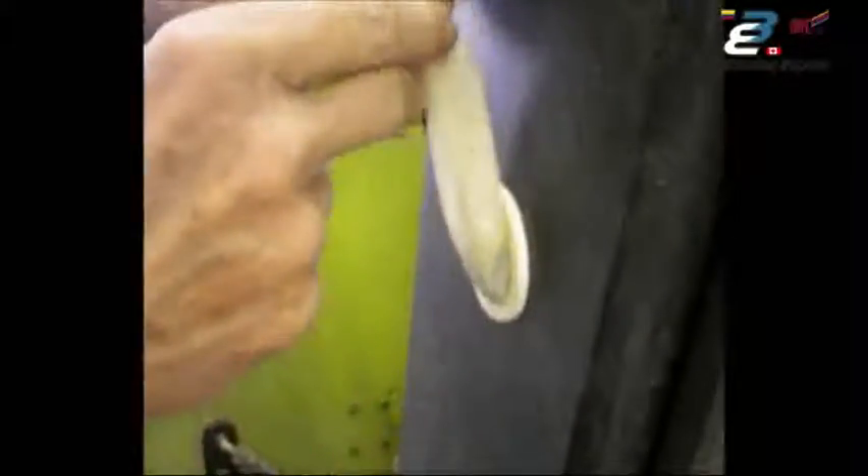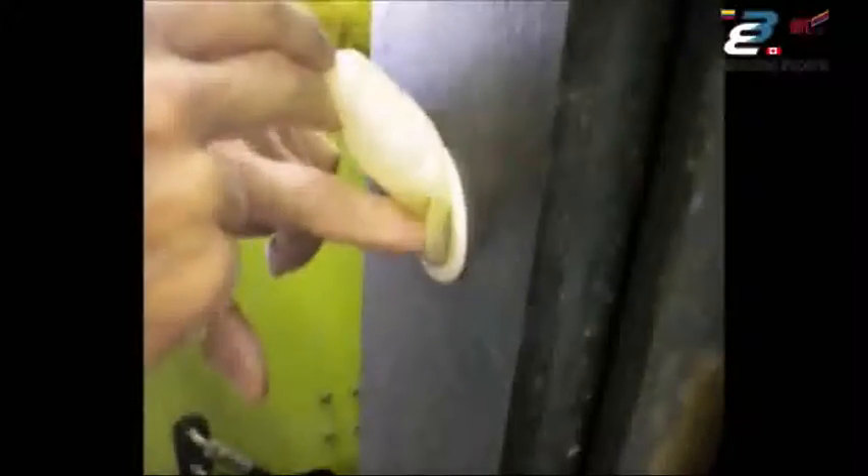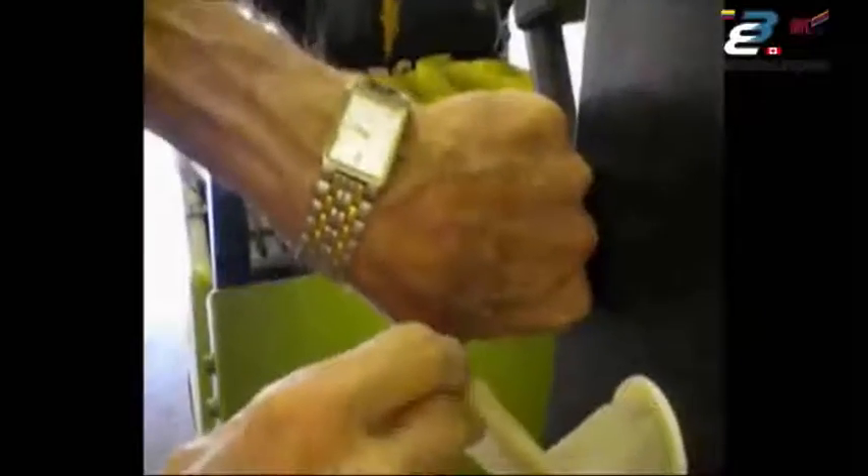Lift the sleeve from the bottom end so that the extract runs against the steel surface, then massage it with your finger. We recommend massaging it for two minutes. Most people have a hard time gauging two minutes, so we suggest you use a watch with a second hand and actually time the amount of time you're massaging that extract to make sure you've got the full two minutes.